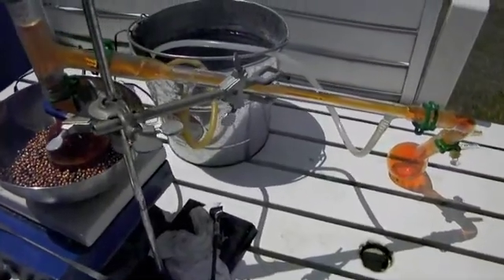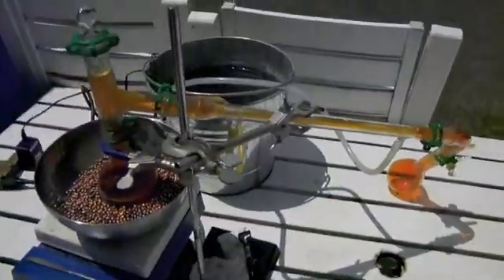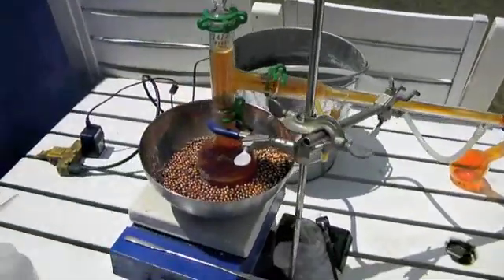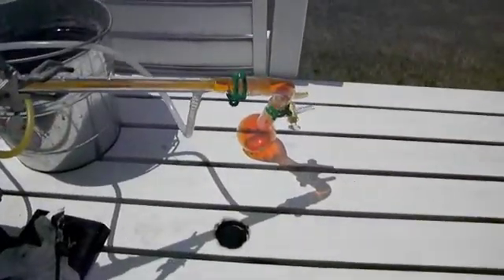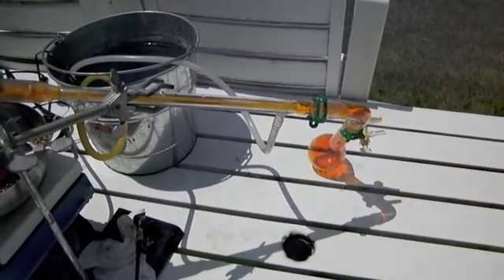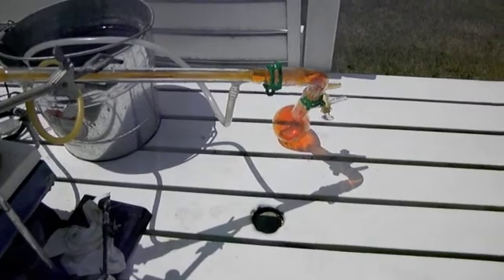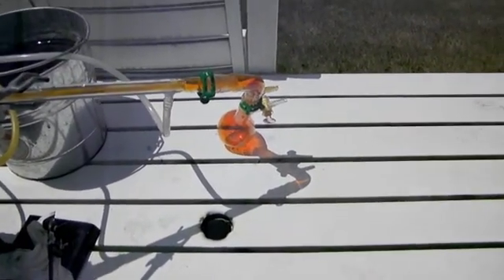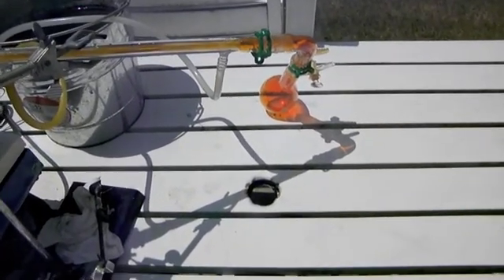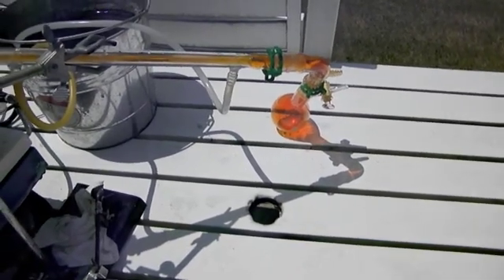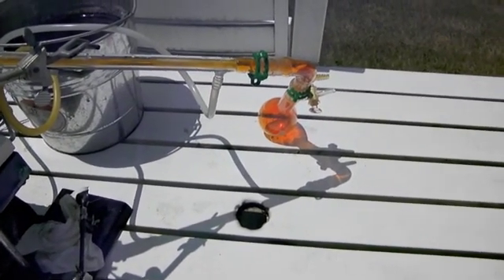Here we're a little bit further along in the distillation procedure. Unfortunately, because we were out in the hot sun, the condenser was not working quite as well as I would have liked, and so more bromine vapor is exiting the apparatus through the vacuum takeoff port than we intended. However, we will add an ice bath to the receiving flask and further chill the condenser water to recover as much bromine as possible.